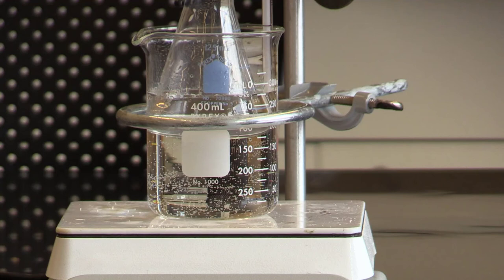The temperature for this reaction needs to be at least 50 degrees Celsius and cannot get above 60 degrees Celsius. If the temperature gets above 60 degrees, we will turn off the hot plate, let the temperature cool down to 55 degrees, and then turn the heat back on. The reaction will go for 20 minutes.